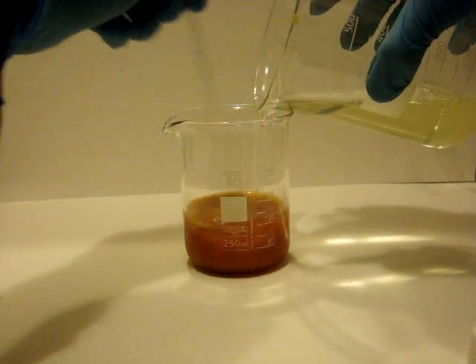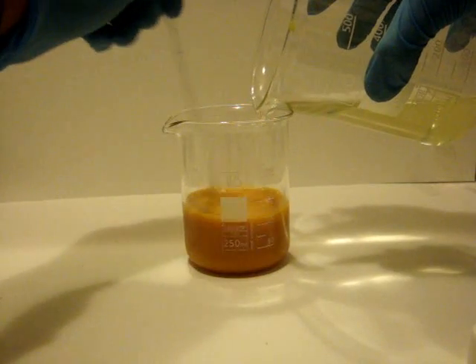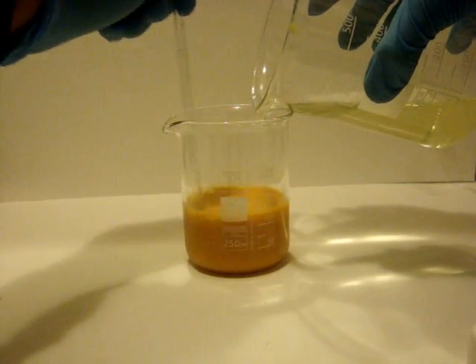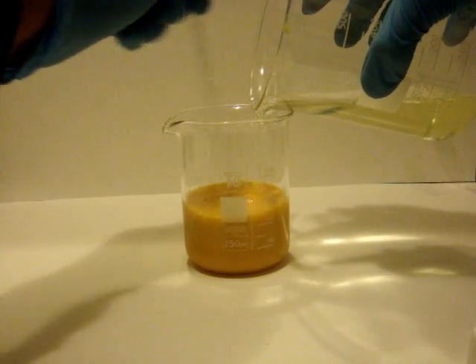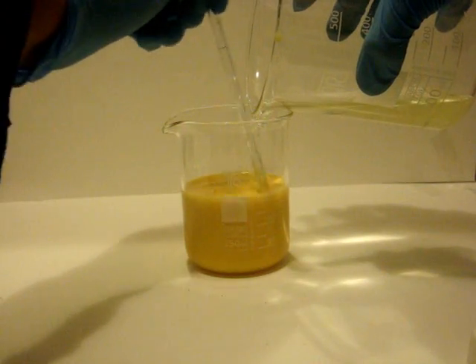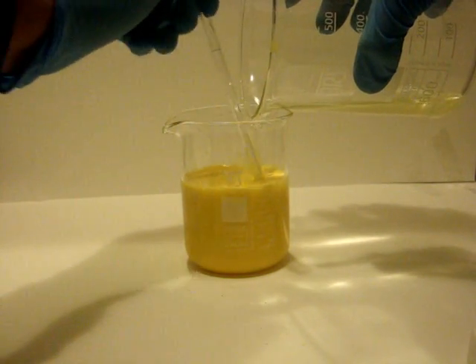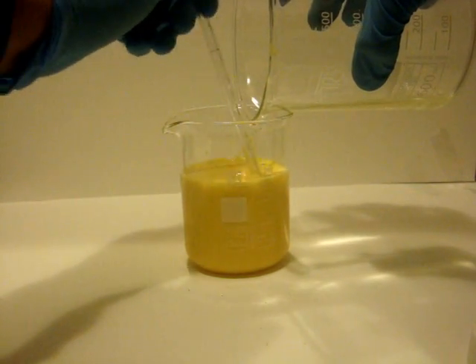Molecular iodine forms instantly, but going on with the operation and mixing it becomes iodoform — a nice yellow colored jelly that precipitates out.